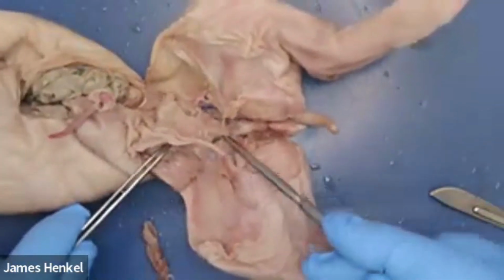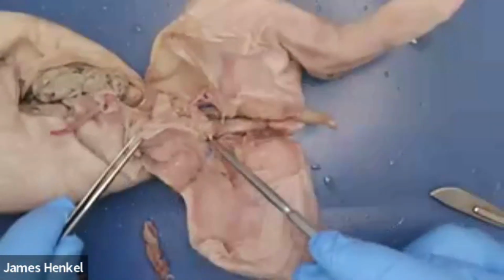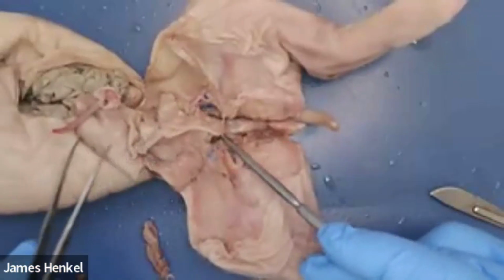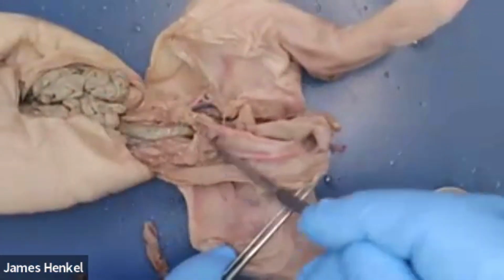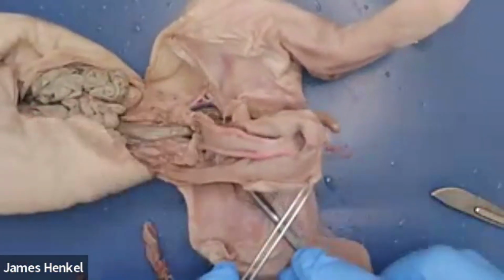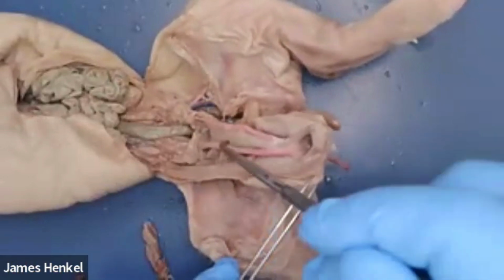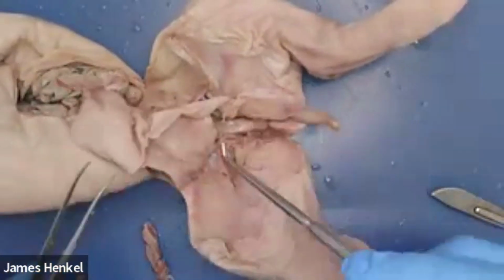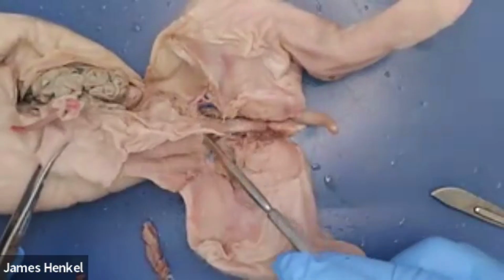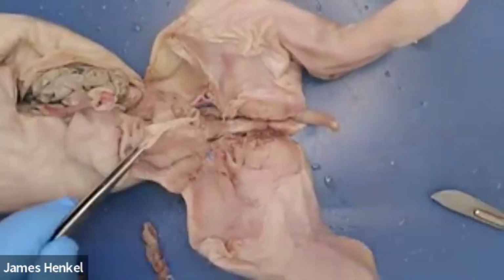But you can see that I'm using the blunt probe to briefly disconnect some of the tube from the other tube while seeing that it connects to the bladder, the base of the bladder, and it comes out in this urethra. So it takes the urine and puts it into this larger cavity. So the urethra is here, as you can see where the probe is, and you can separate it out a little bit further.